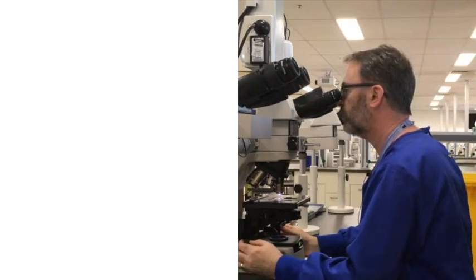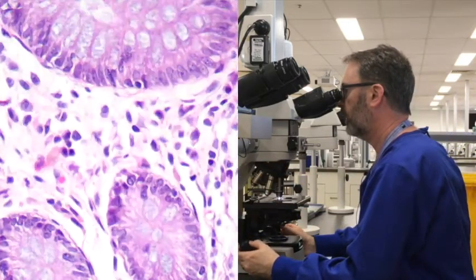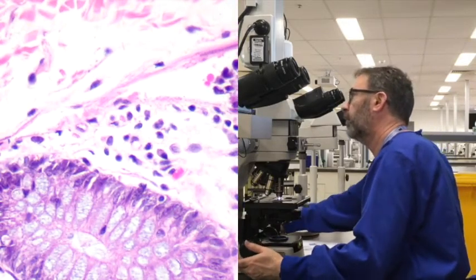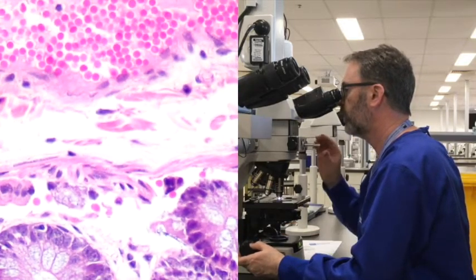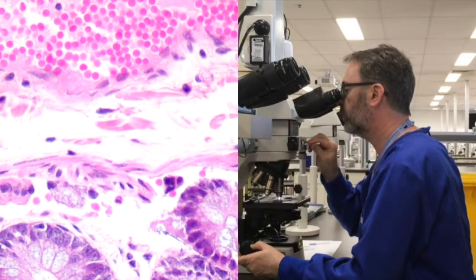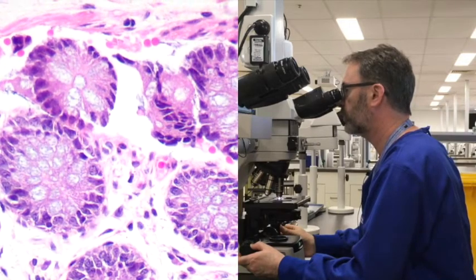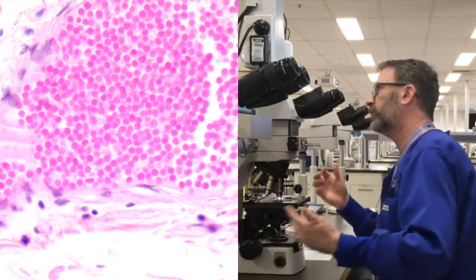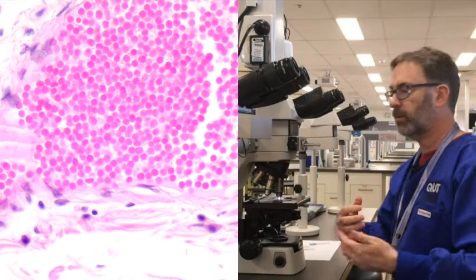If we look at this slide here, this is one that has been earmarked by Chris and Jess, our technicians, as being a good example of hematoxylin staining. And indeed, it looks pretty good. It's a section of colon, as you can probably make out there. It appears to demonstrate all the features that you'd want to see, starting with cell nuclei. We can see these arrangements of cells within the mucosa. The nuclei are certainly well stained. And if we look at these red blood cells here within this vein in the connective tissue, certainly it's nice and bright and pink. And so the blue and the pink seem to be in correct balance.